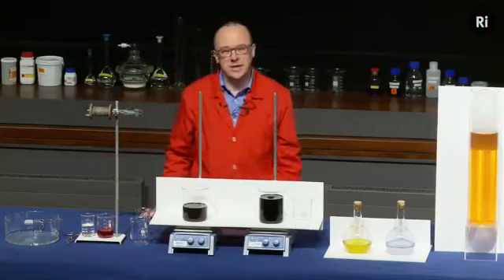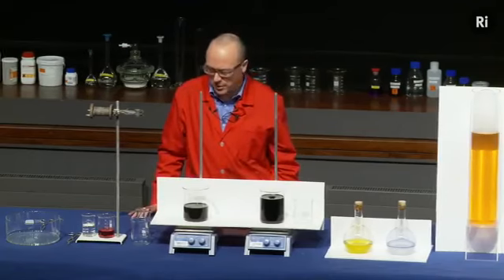Okay, so that's a sort of two-stage clock. So I'll leave you to think about how that one might be working.